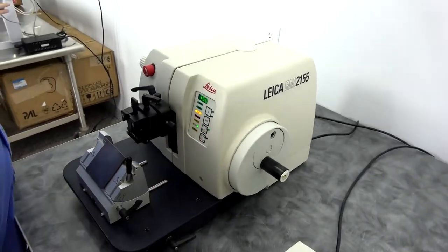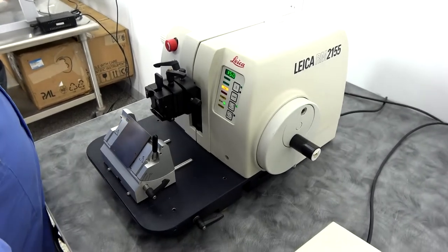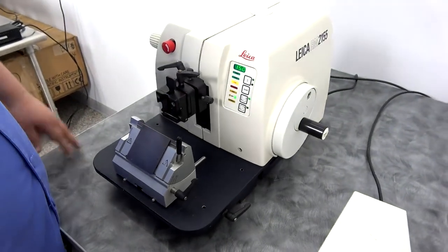I'll show you the single cut operation. You just put it up to the single cut, tap that, and it will make your single cut.